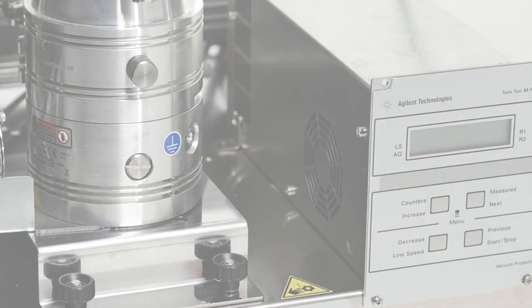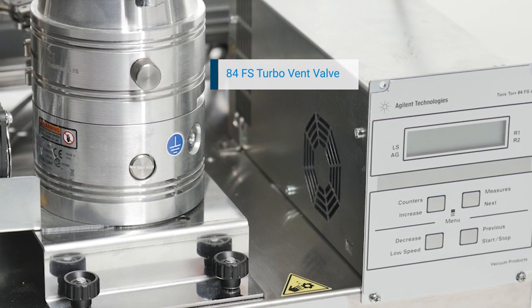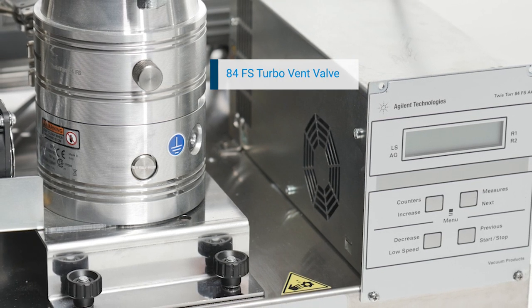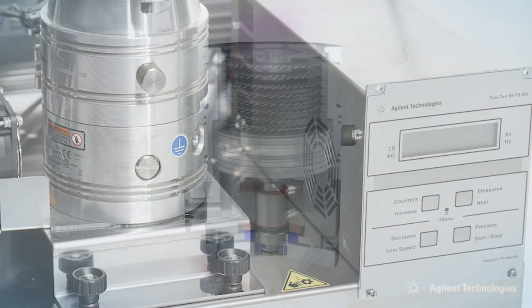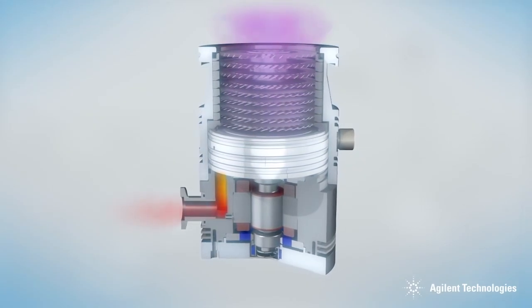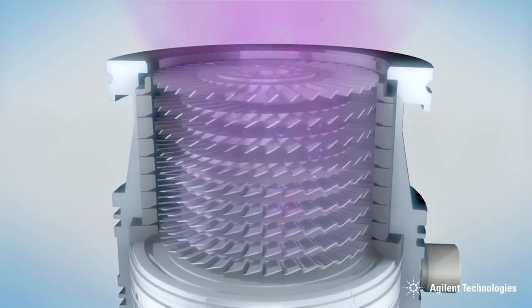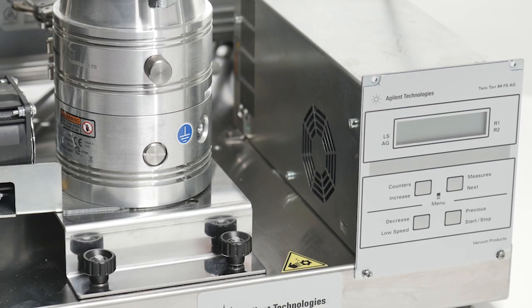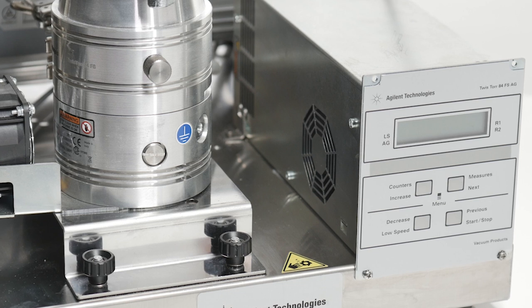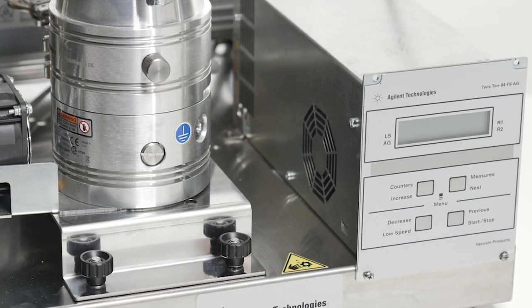You can see here that the location of the vent valve on the 84FS turbo is roughly in the center of the pump's blade section. That means that the gas entering the pump is distributed evenly and doesn't drastically lift the suspended rotor or drop it against its spring-loaded suspension. That way we practically eliminate the possibility of exceeding those tight clearances between rotating and stationary components.